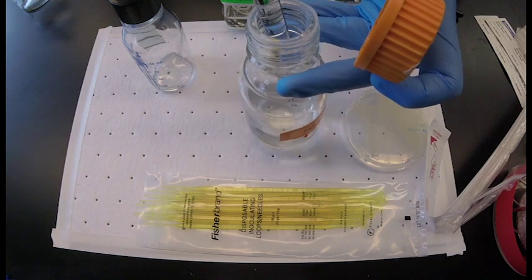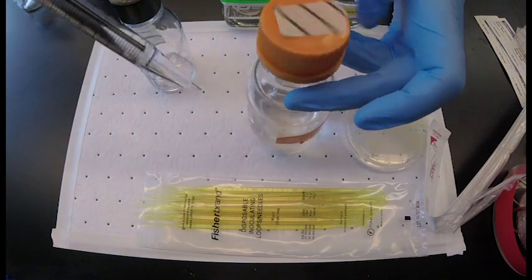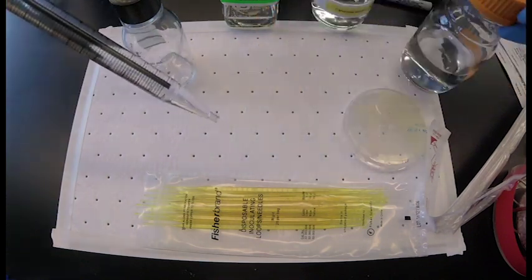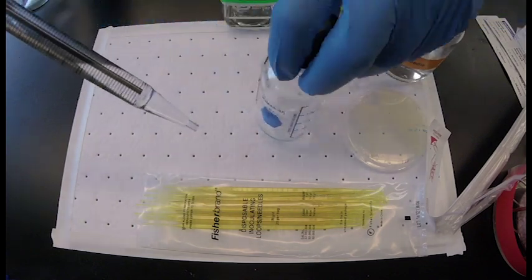When making media, it is important to keep bottles open for as small amount of time as possible. This is to reduce contamination.